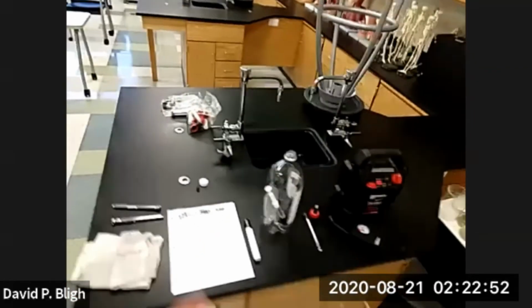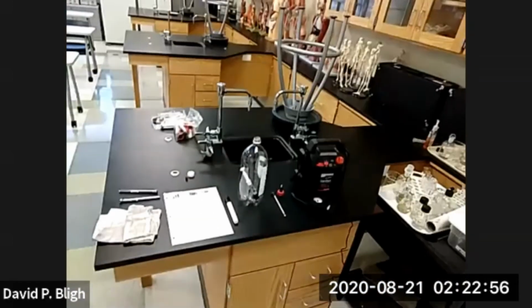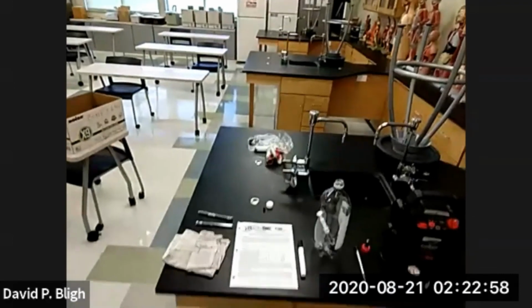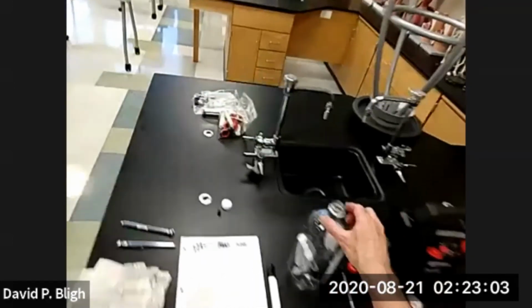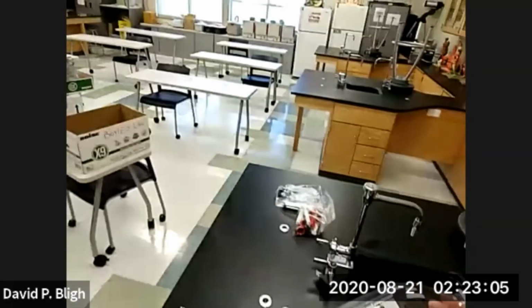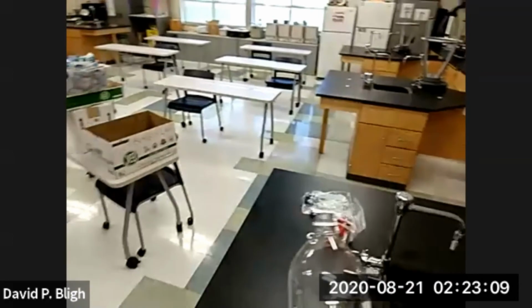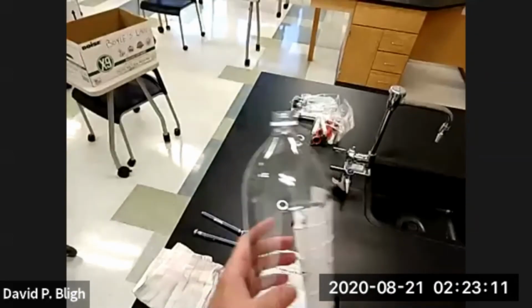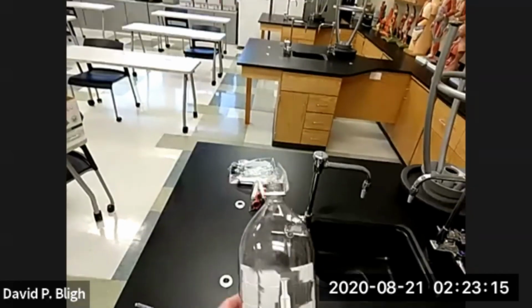Safety, you want to consider safety. So when you do this experiment, what are your safety considerations? Well, primarily is increased pressure inside a container, right? Inside this vessel, the pressure went up to 60 psi. Now these bottles are made out of PETE, and there's a question about that in the document.